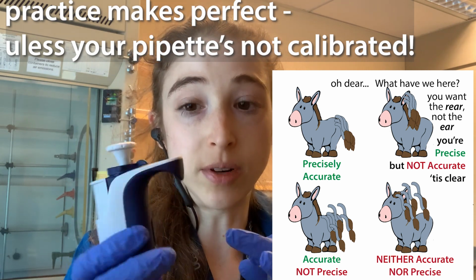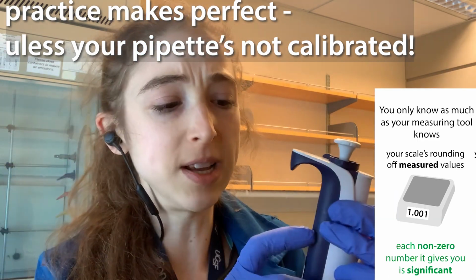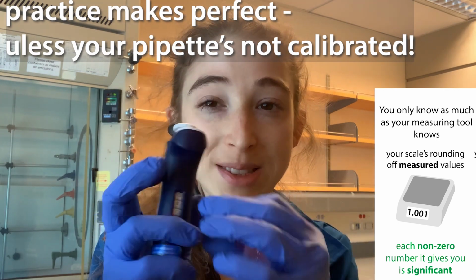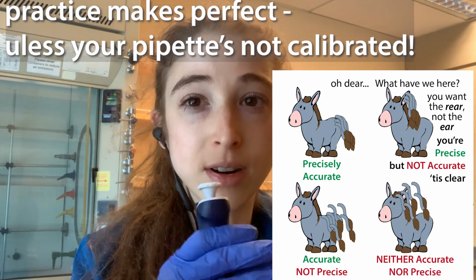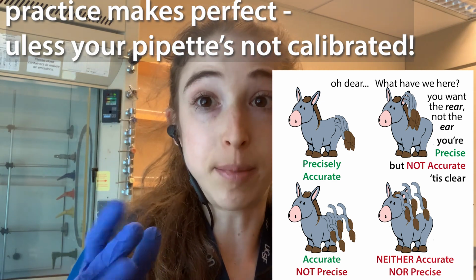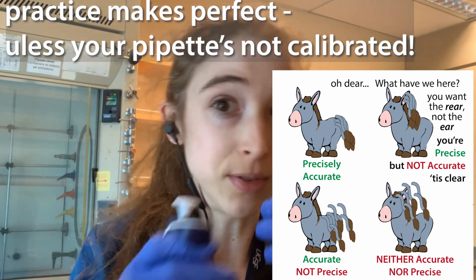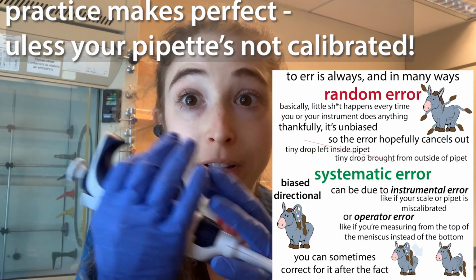There's another way of defining precision, and there's a couple ways. One is how many digits you can get on your pipette. So the precision you think you have is based on the pipette in a way. But then how close together all your individual pipettings are would be a measure of precision. I think of pinning the tail of a donkey: how close together those donkeys' tails are would be precision. But what if you're not actually on the donkey's tail, you're on the donkey's head, even though they're really close together? That wouldn't be accurate. So accuracy is going to depend in this case on how accurate your pipette is.